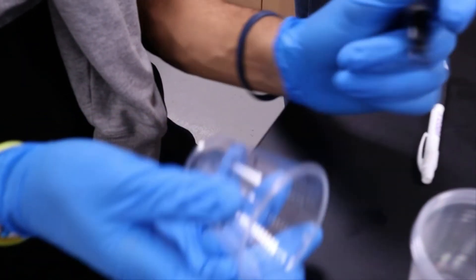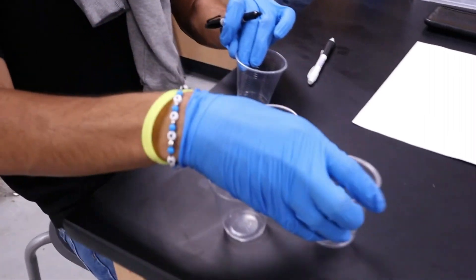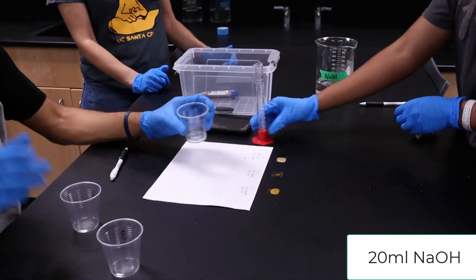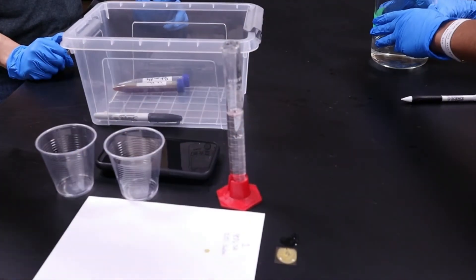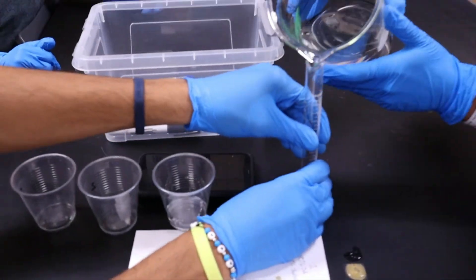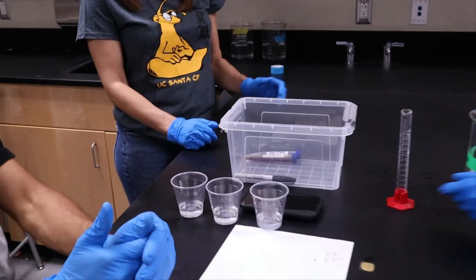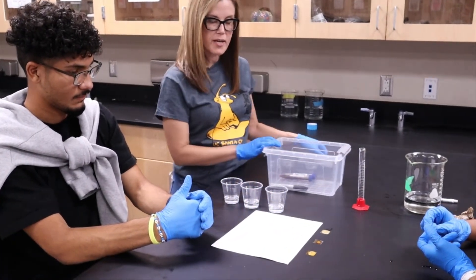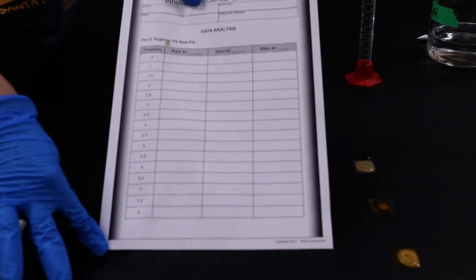At this point we're going to set up our cups and label them one, two, and three for ratio one, two, and three. We're going to fill the cups with 20 milliliters of sodium hydroxide — all three cups will have sodium hydroxide in them. At the end of the five minutes, you're going to drop the three cover slips into the three containers of sodium hydroxide and make observations on your lab journal for a total of eight minutes every half a minute.